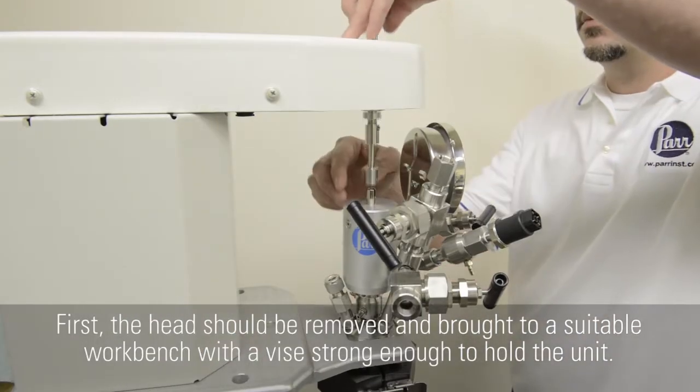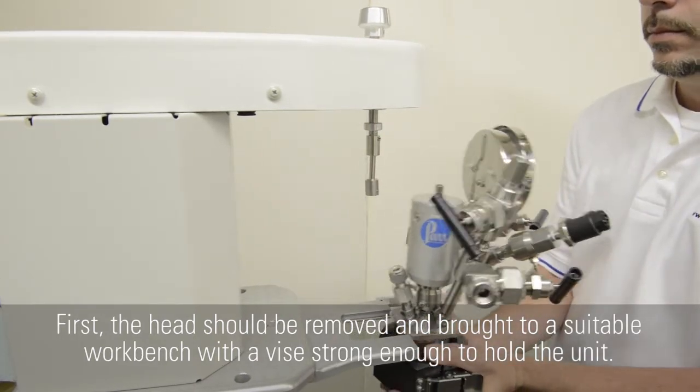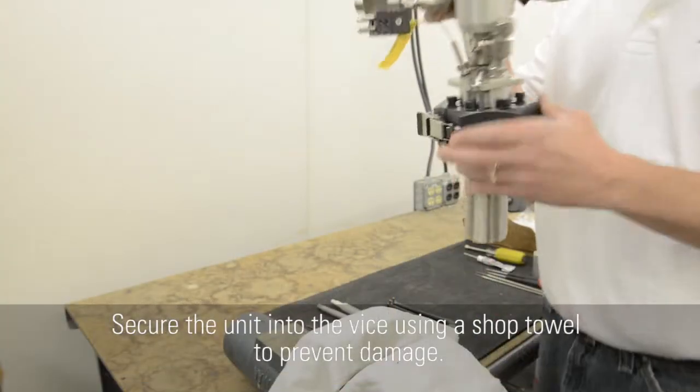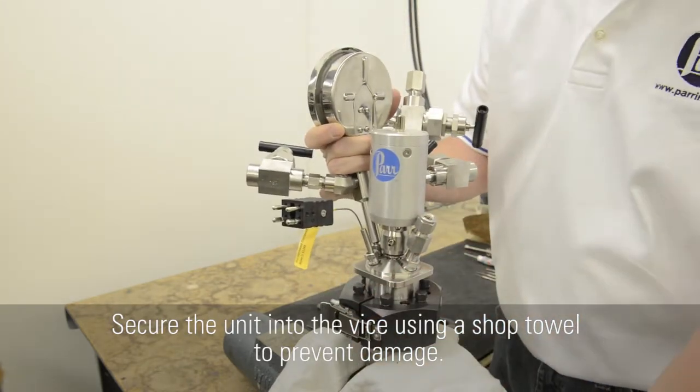First, the head should be removed and brought to a suitable workbench with a vise strong enough to hold the unit. Here are the tools you'll need. A pair of dental tools makes removing the various O-rings easier. Secure the unit into the vise using a shop towel to prevent damage.